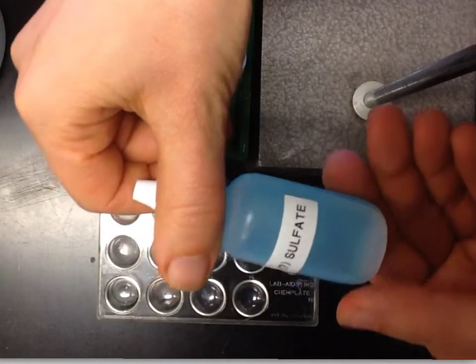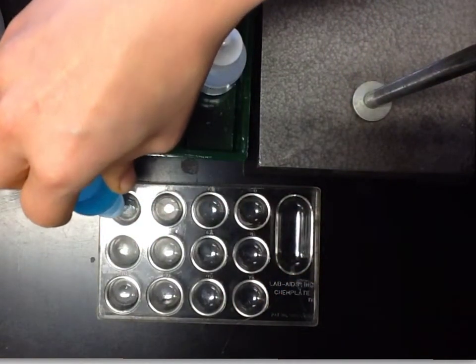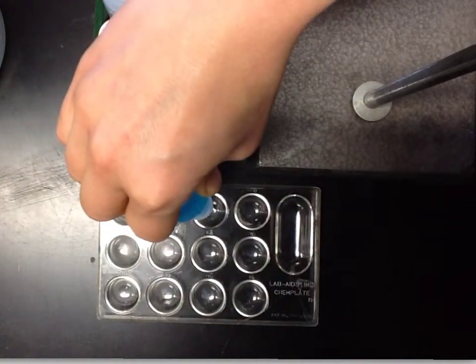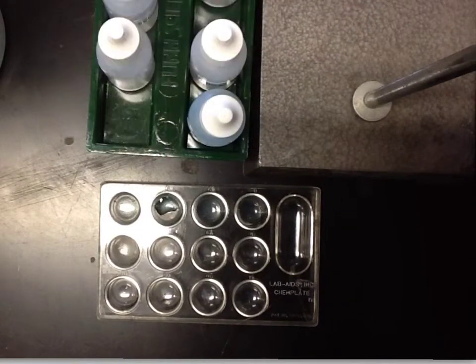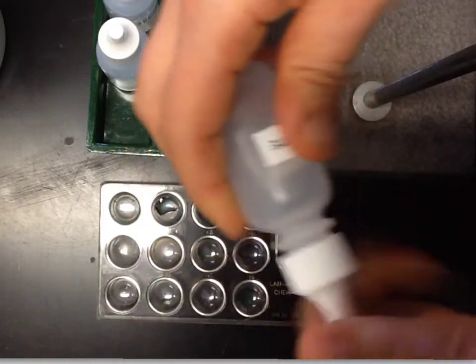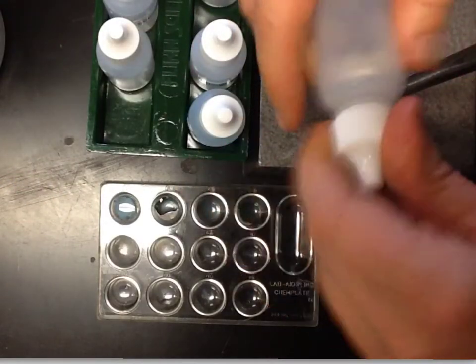Okay, so what we're looking at here is mixing ionic compounds, and that's copper 2 sulfate in the first row. We're going to put 3 drops in every well. Copper 2 sulfate is an ionic compound that's just been dissolved in water, and now it's free-floating cations and anions. Next we're going to mix sodium phosphate into the first well, another 3 drops, and see how those come together. We can see there's a cloudy precipitate that forms.